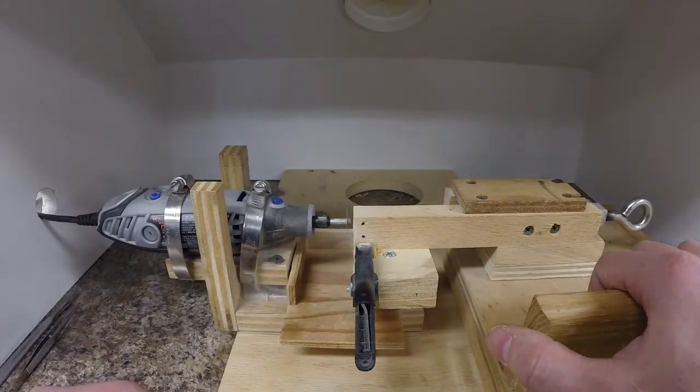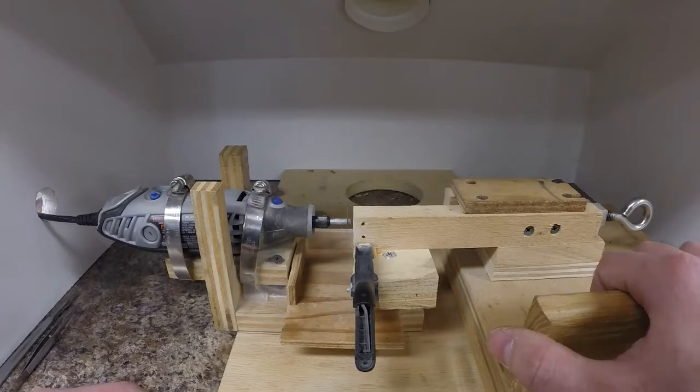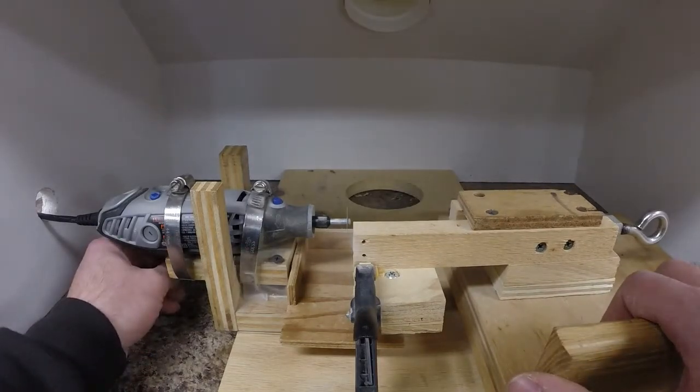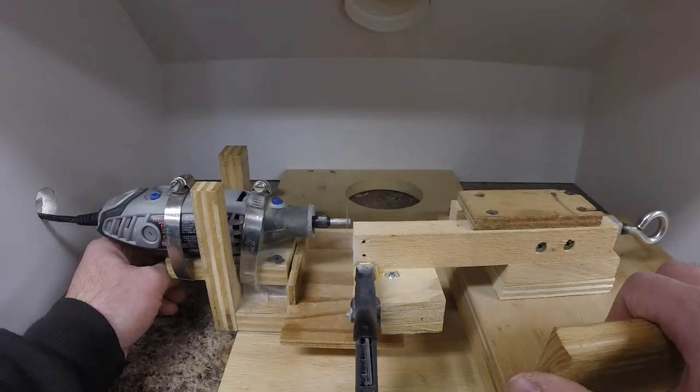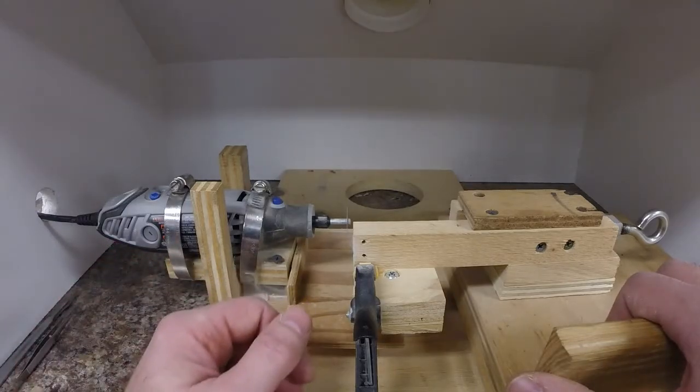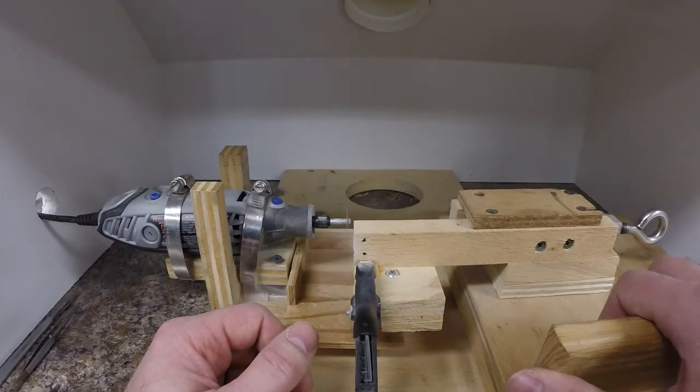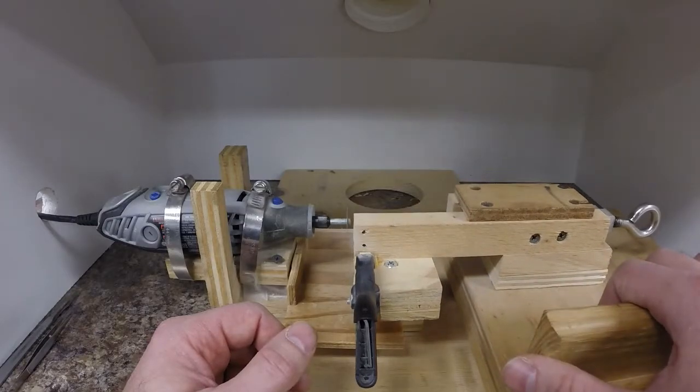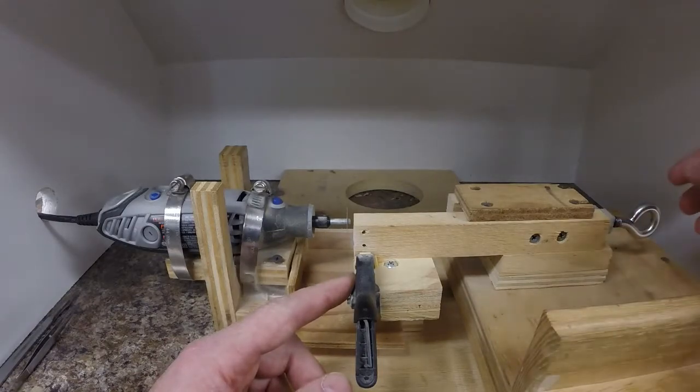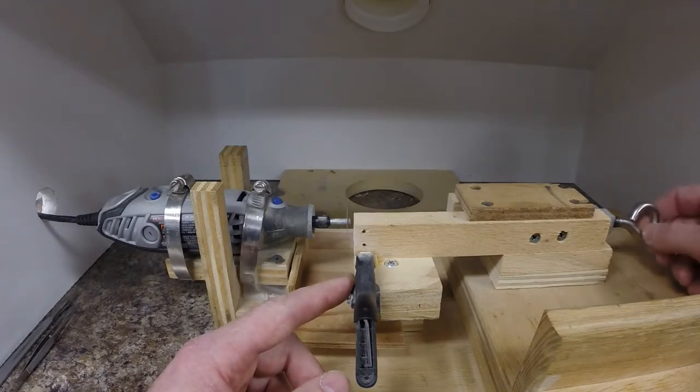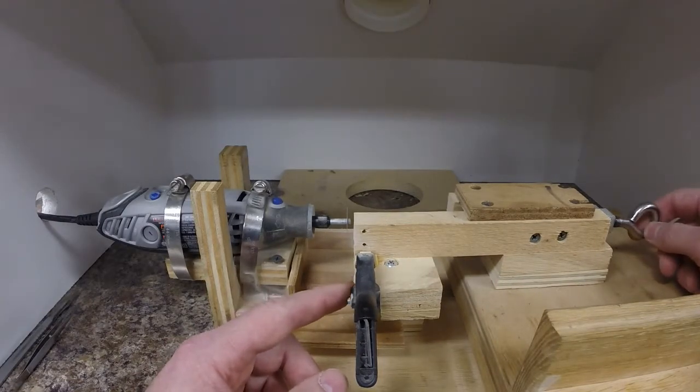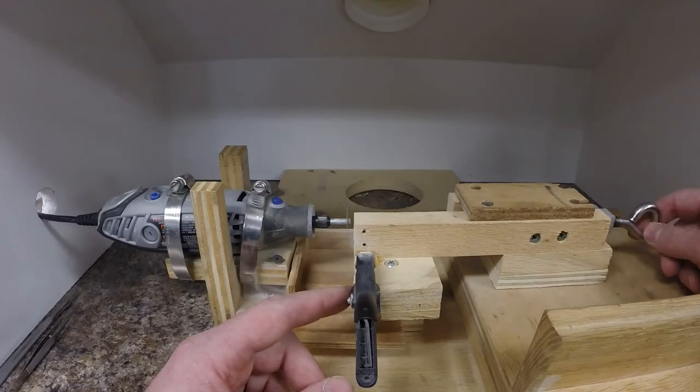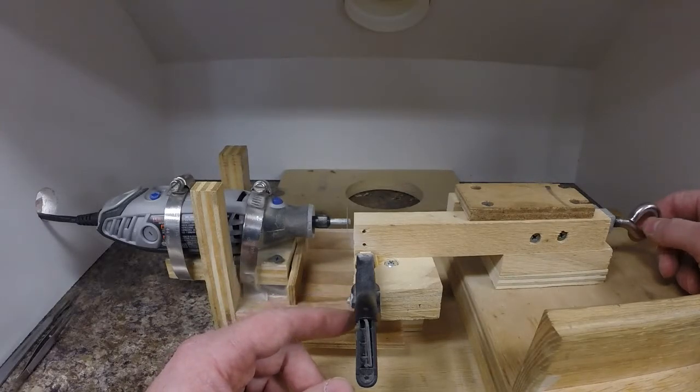There are advantages and disadvantages to each type of spine cutter. I think there are basically two main advantages to this one. One is that because you're clamping the structure in and running it through on this carriage, you never have to put your fingers anywhere near the blade when spinning, so it might be a little safer than some other ones. The other advantage, and I think it's the big one, is that because you're clamping the structure in and adjusting the thickness of the cut with the screw, you get a lot of consistency in the thickness of your sections within a sample and between samples.